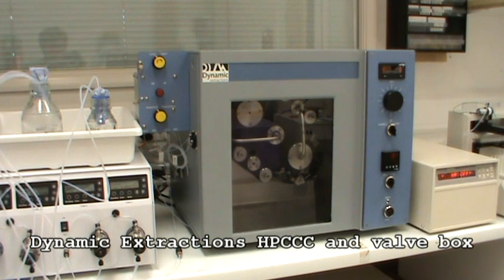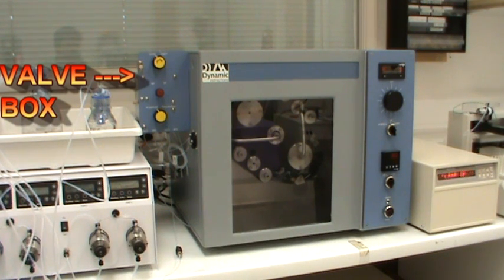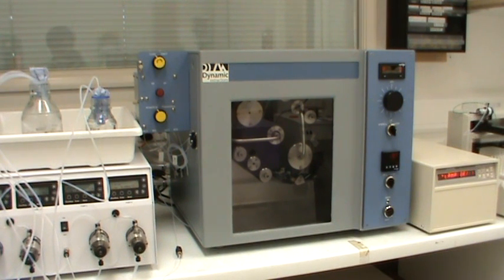Next comes the Dynamic Extractions Spectrum HPCCC instrument. Also shown is the Dynamic Extractions valve box which allows you to easily change between analytical column and preparative column, normal phase and reverse phase, and also allows you to easily inject and load samples.